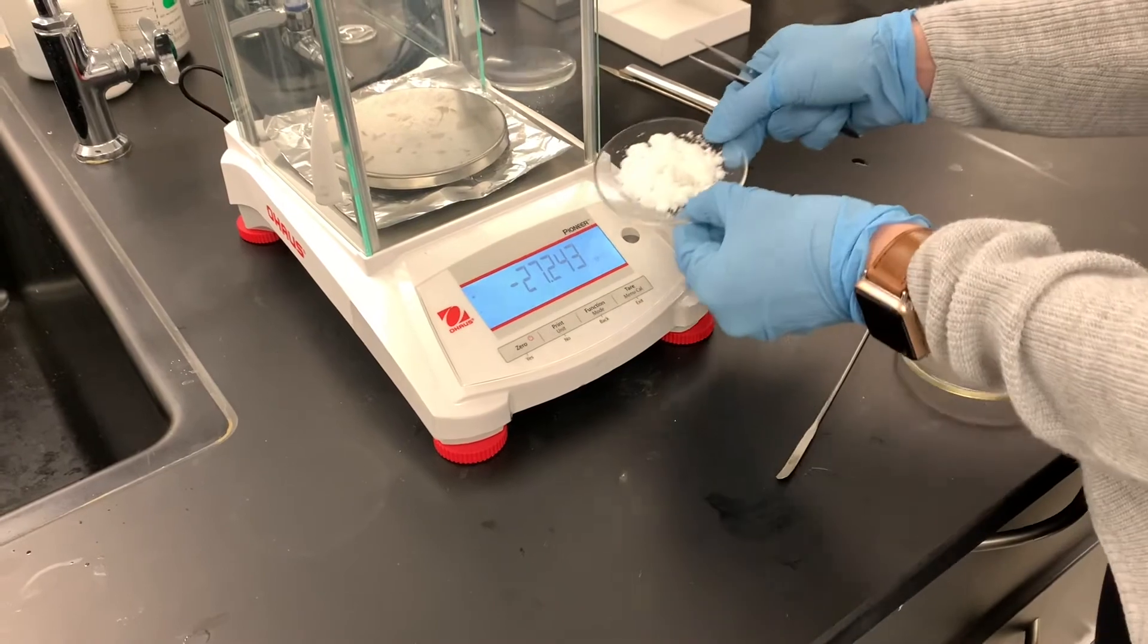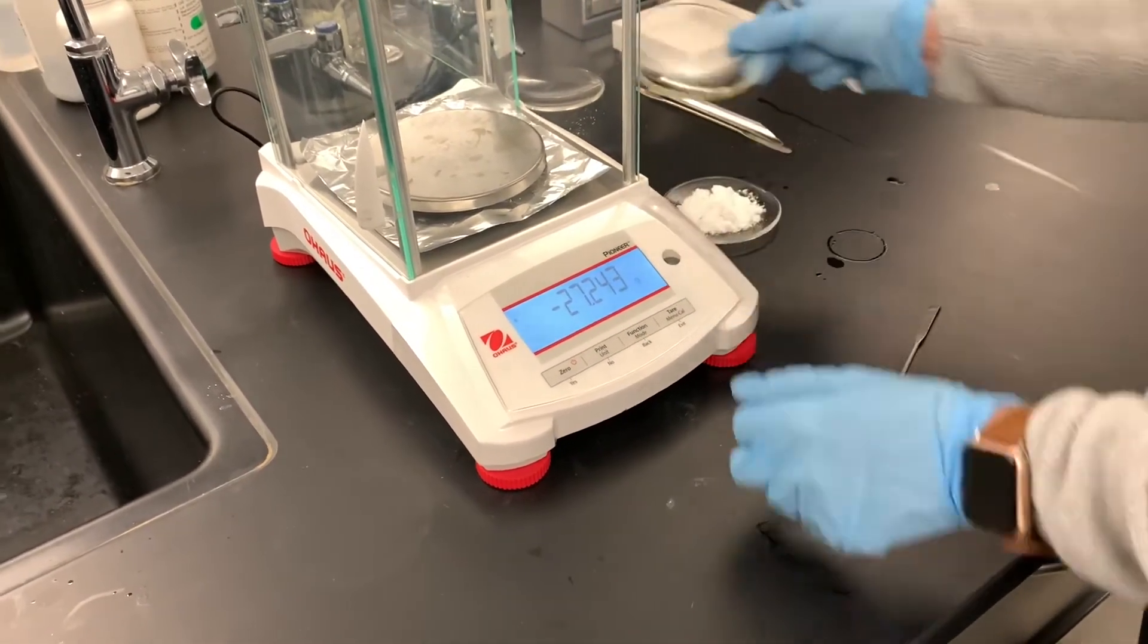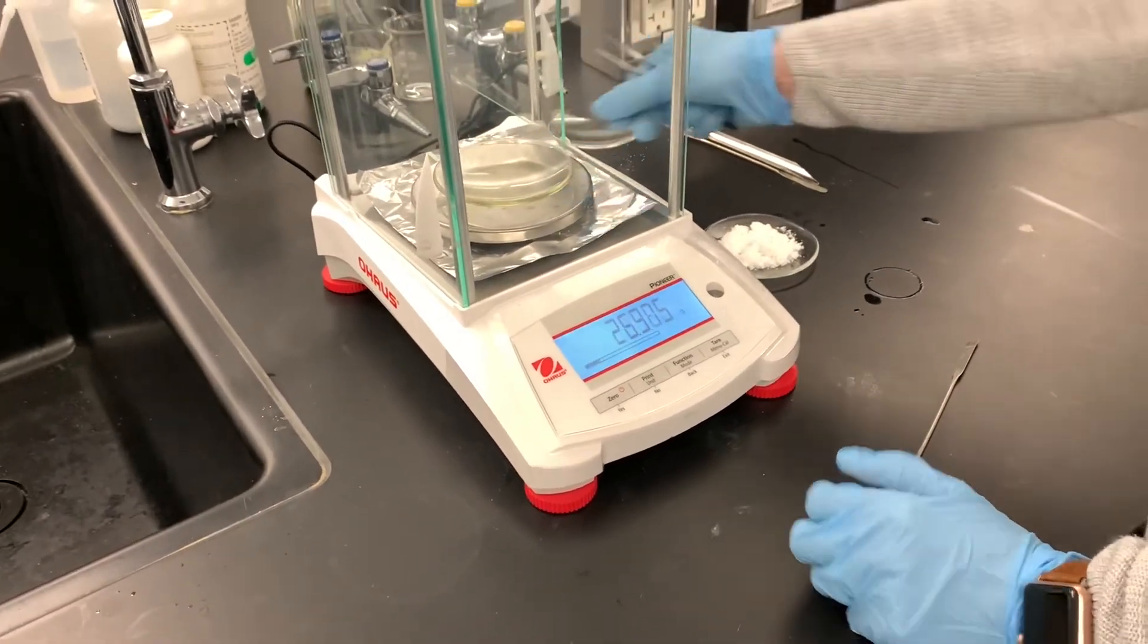This is our crude camphor product. It's been drying overnight. We're going to get a mass on this. I'm going to be transferring it to a clean watch glass.